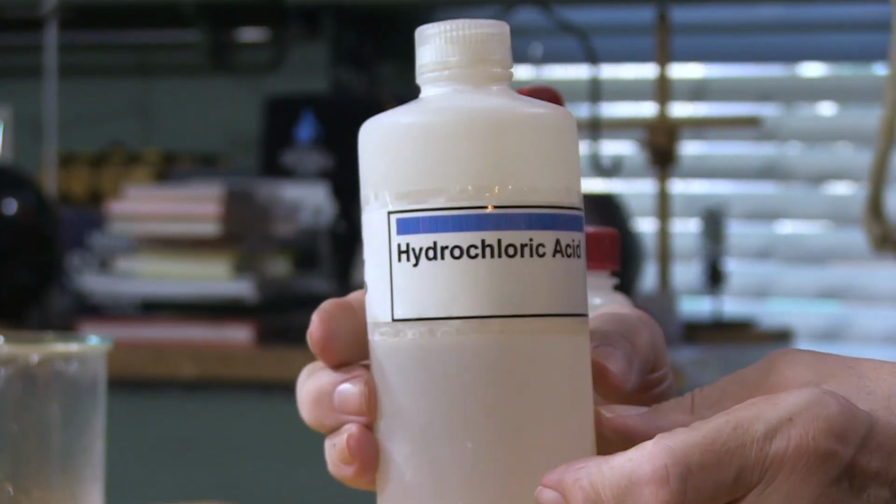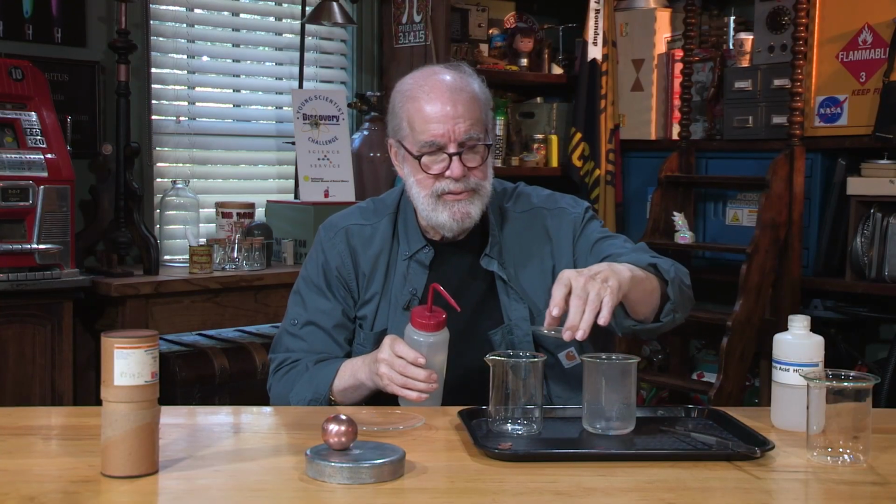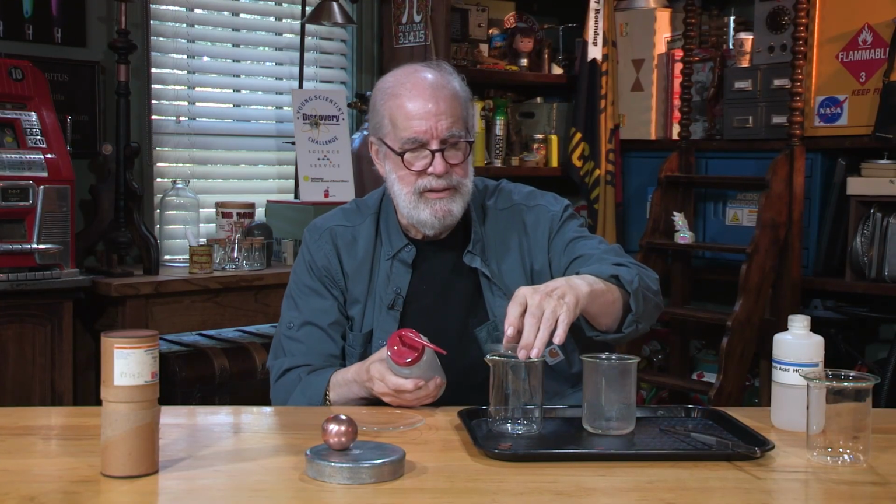Hydrochloric acid, that's mean stuff. I tell you what, in an emergency, this will really clean your teeth. Fast, but I don't recommend it. I'll get in trouble. Just in case I get some on my fingers, and I'm just gonna, never mind. You see that steaming? Ooh, wee.